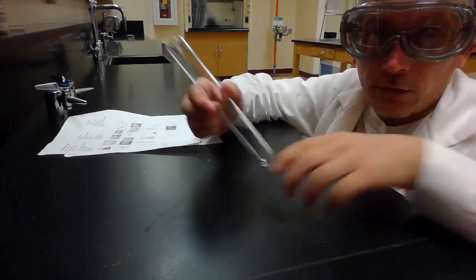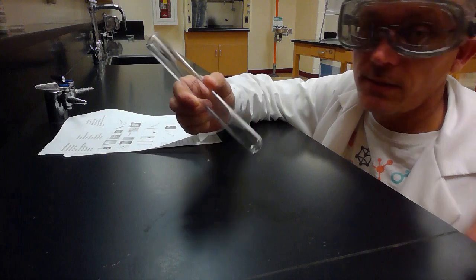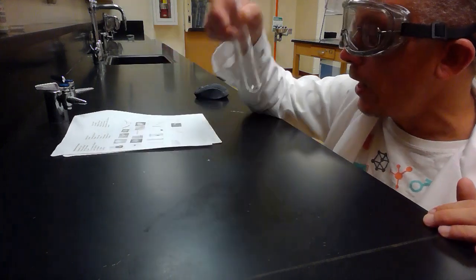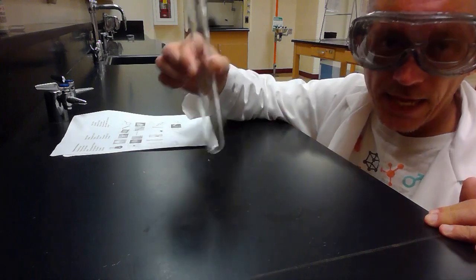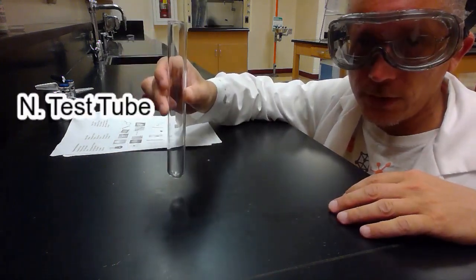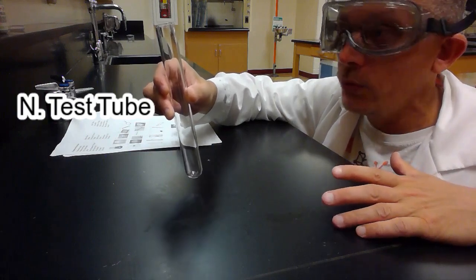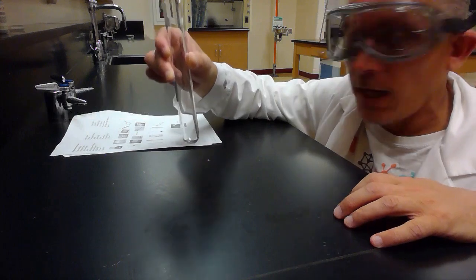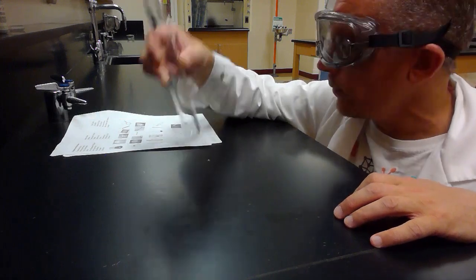In our last video, we talked a little bit about test tubes, and we talked about safety with test tubes. Never point a test tube at somebody, right? The test tube is picture N on your assignment there. A test tube, you can use it to hold some chemicals. You can use it to mix some chemicals together, something along those lines. Picture N, the test tube.